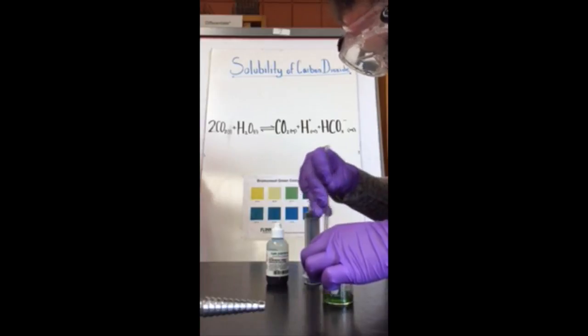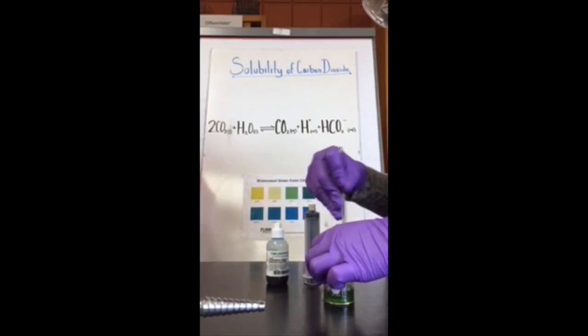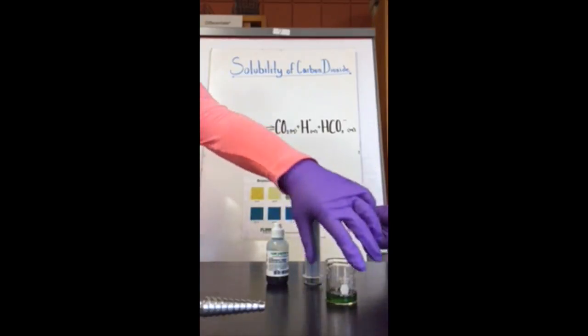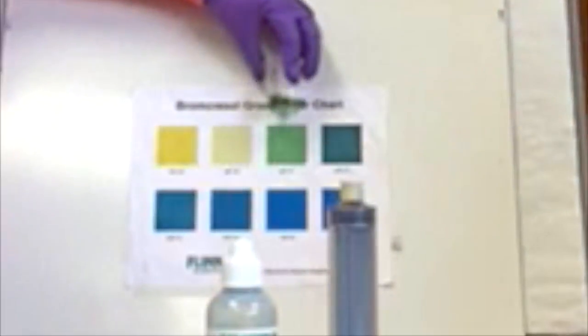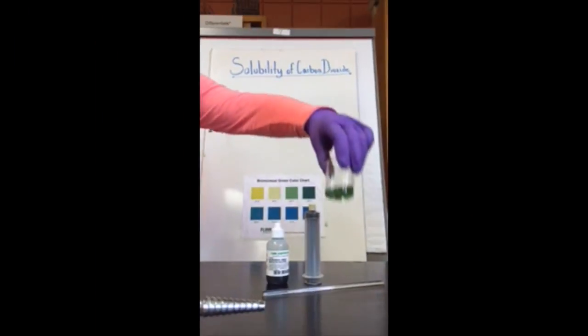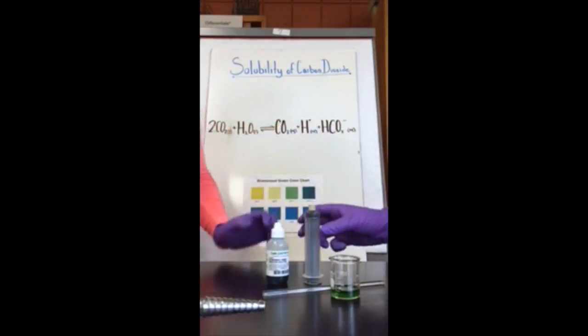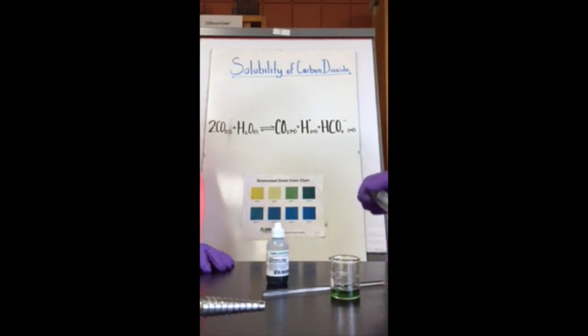And as she's stirring it, the bubbles are the carbon dioxide being released. Alright. So by this chart, we can see that the pH of this is about 4.2. So now we're going to pour the solvent into the syringe, the 10 milliliters into the syringe.